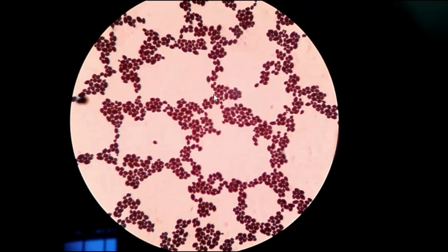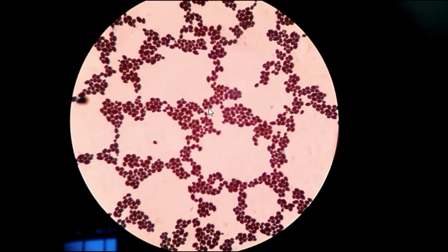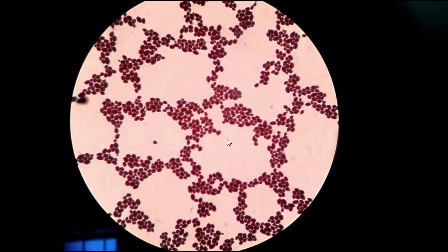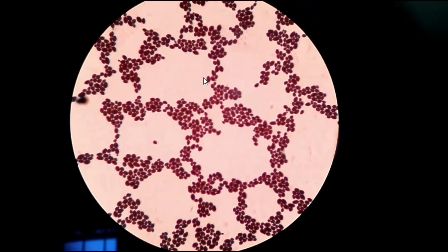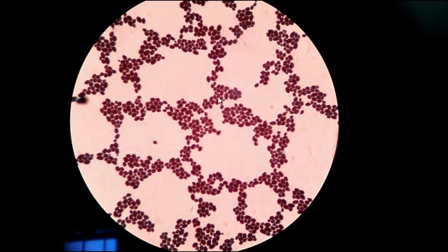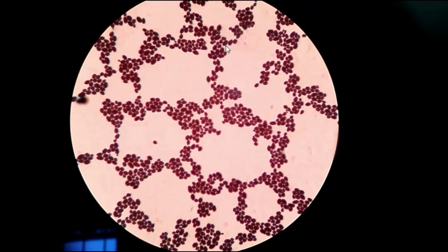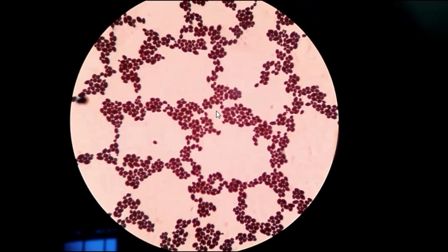Here you can see they are violet in color. The cells are unicellular, commonly oval in shape, but some may be elongated or spherical. They have a highly variable size — width 1 to 5 micrometers, whereas length is 5 to 30 micrometers. These are all yeast cells of Candida species and they are gram-positive.